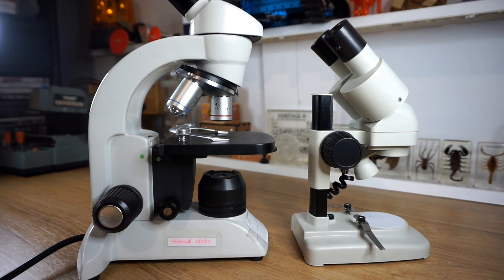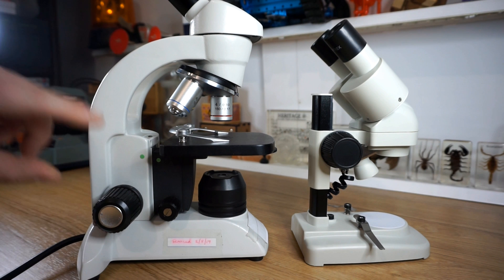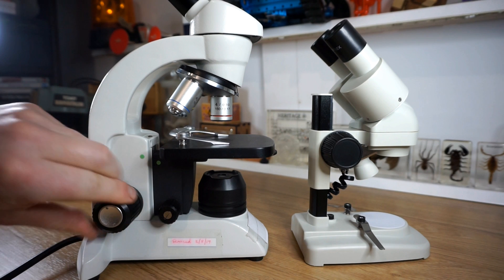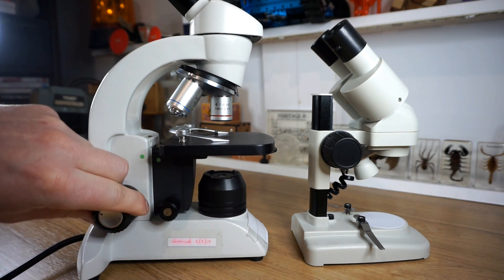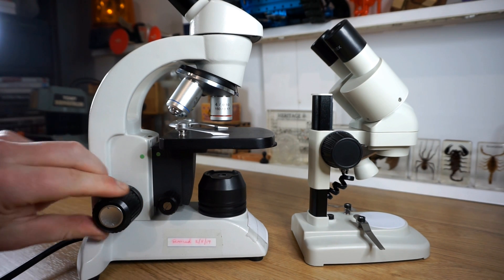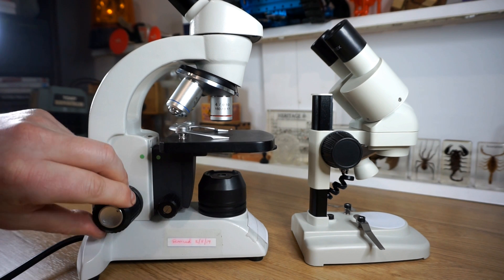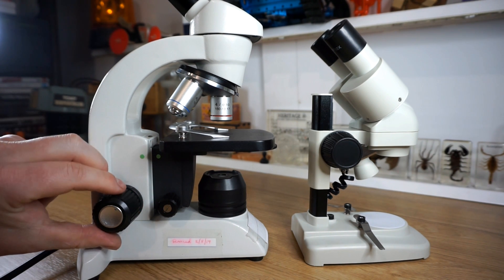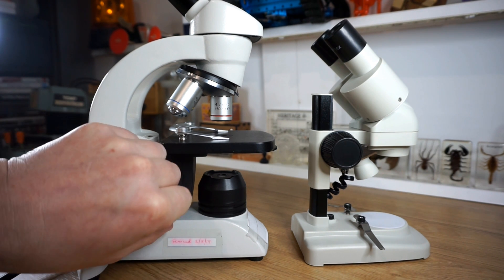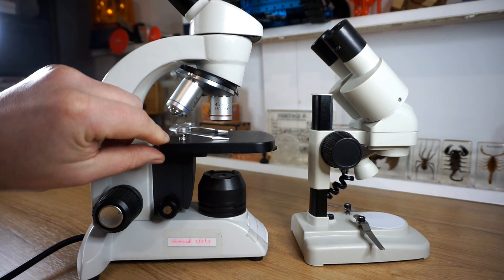Another really important feature you need to know when using microscopes are these knobs or dials. The larger one is called the coarse focus knob. By rotating this, the whole stage moves up and down. When you're looking through the eyepiece at your specimen and moving this large coarse focus knob, the specimen will come into focus. When it starts to come into focus, you can switch to the much smaller knob called the fine focus knob, which allows you to get a much sharper image by moving the stage in much smaller increments.